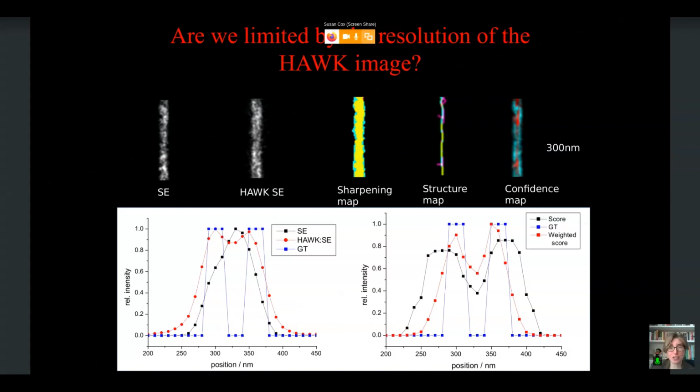This does start to show you that there may be some missing structure there below the resolution limit of either super resolution image, that we're able to see this highlighted gap between the two outer areas, that we have some degree more confidence in the outer areas, but in the inner areas we're pretty sure that there is some structure there that it shouldn't be there.